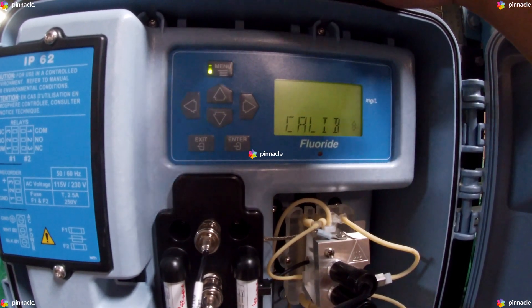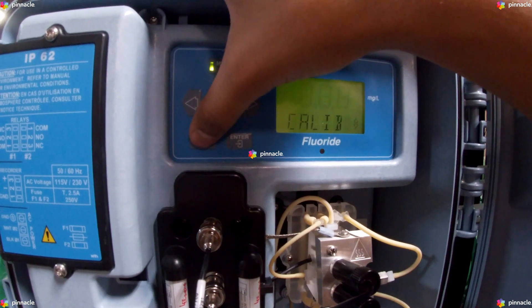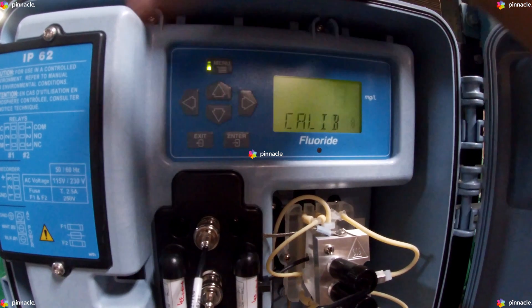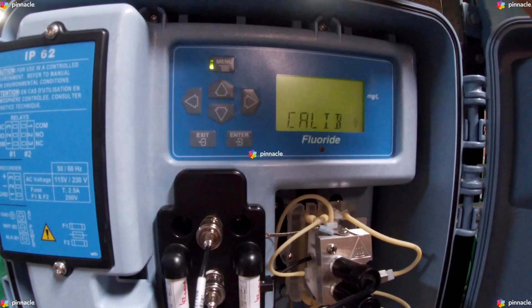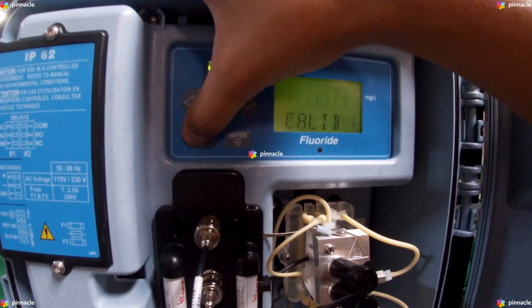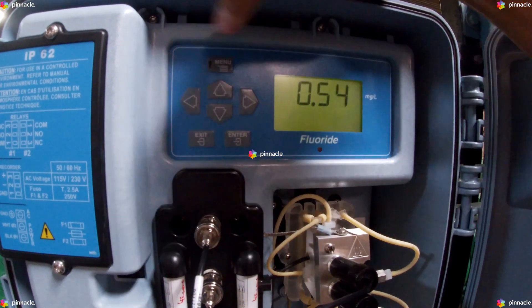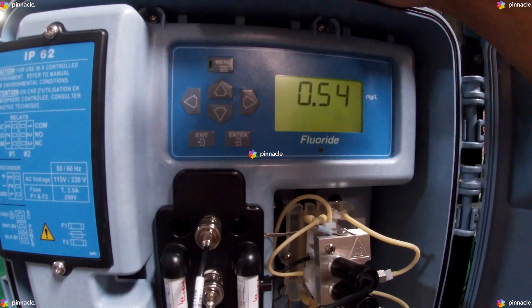Once we initiate our calibration, the instrument performs a calibration which takes approximately 53 minutes.